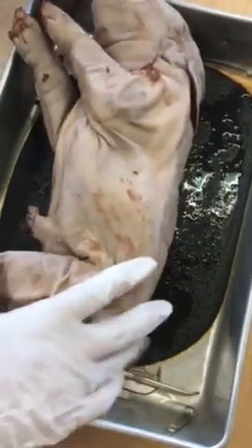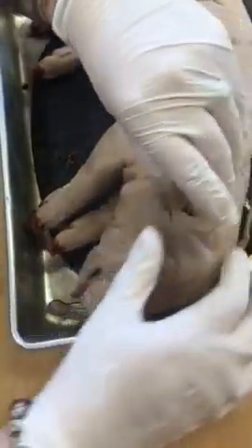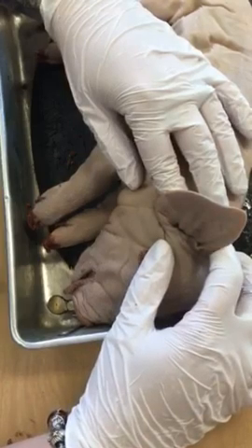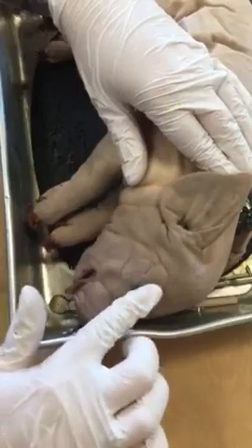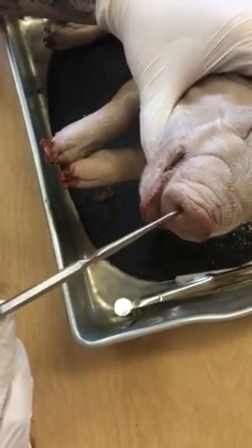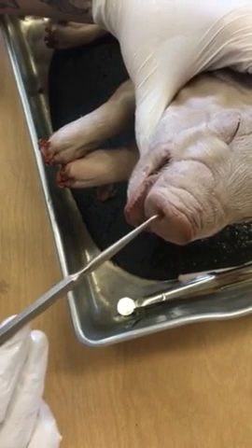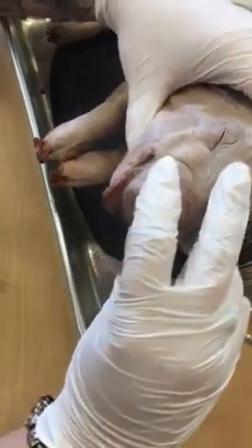Let's see, what else do we have going on with our pig? I'm going to flip him around so you can see him a little bit better. But we have our ears. They're called pinnae. They have a special name. And we have our eyes. And if we look externally, you have your nares. We would most typically call those nostrils, but we're going to use our scientific term, which would be the nares, and those lead into the respiratory system.